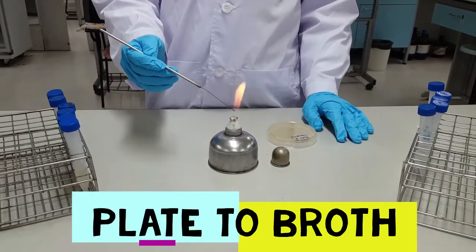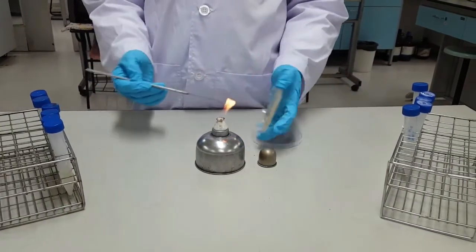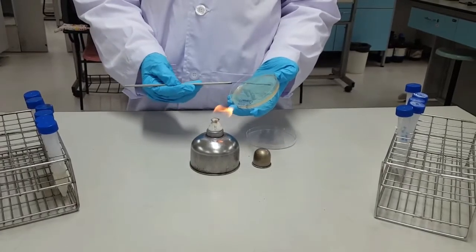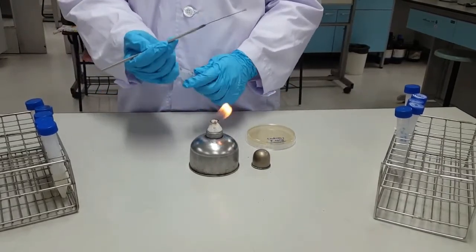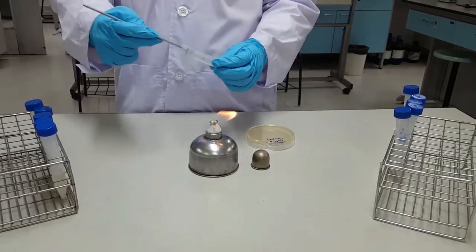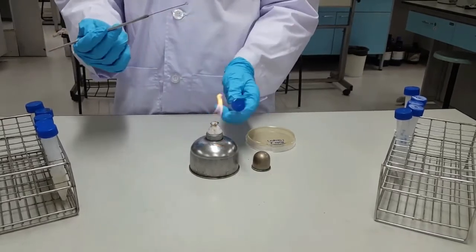Next is moving from a solid plate to a liquid broth. Sterilize the loop, and you want to touch the loop to a spot on the plate without a colony to cool it down and prevent from killing the colony. Then you're going to pick up a single colony while keeping the plate near the flame. Then you're going to heat the lid of the new tube, take the lid off, and flame the mouth. Then you're going to dip the loop into the broth, and then heat the mouth and the lid again. And then you're going to want to flame the loop until it's red hot.